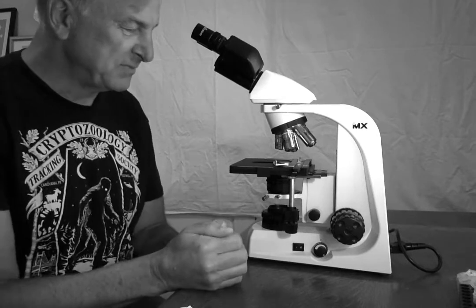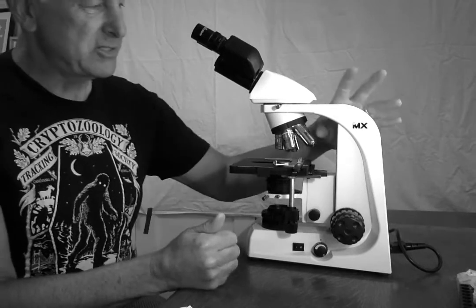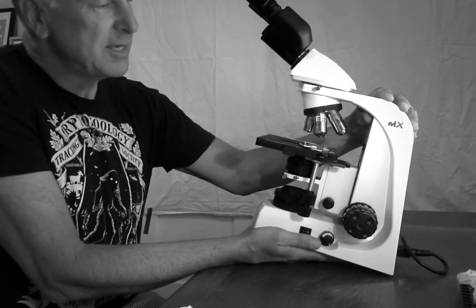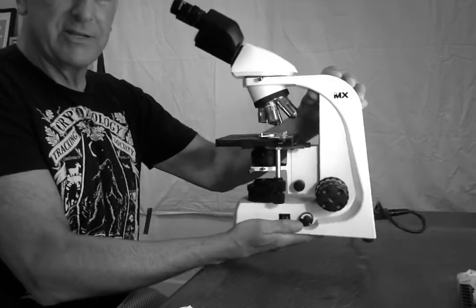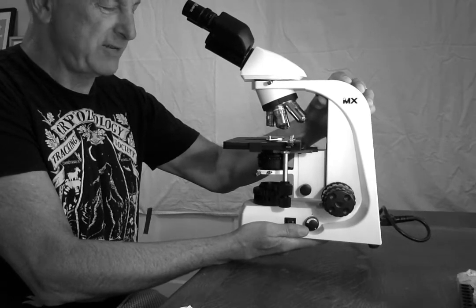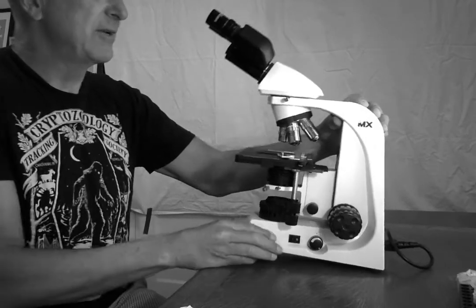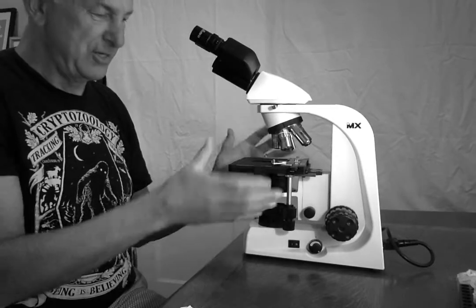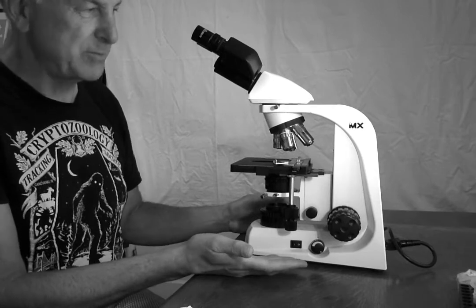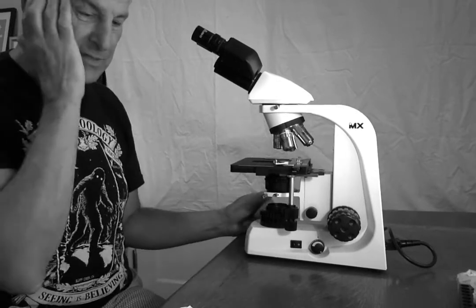First of all, if you're going to carry the Meiji or any other microscope, you should hold it with two hands. One hand on the neck and one hand on the base. These are both very solid parts and a safe way to carry it. If you carry it by grabbing other pieces, you could damage the scope. So always two hands, always one under the base, always one on the neck.